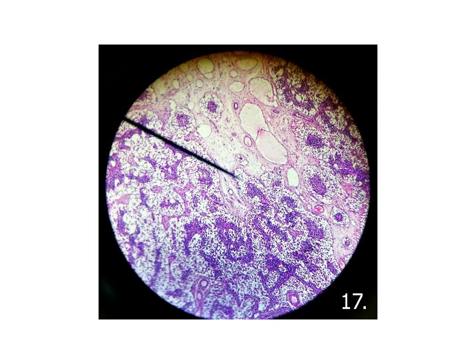Here also it is a picture of the lymph node medulla, and you can see these spicules of medullary cords. This is the medulla, but the cortex is in another view. So if we have rounded follicles on the surface and the spicules in the center, it is the lymph node.